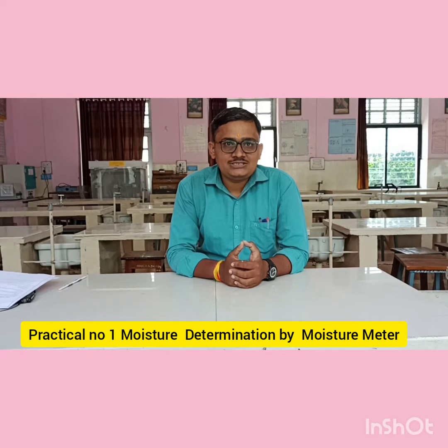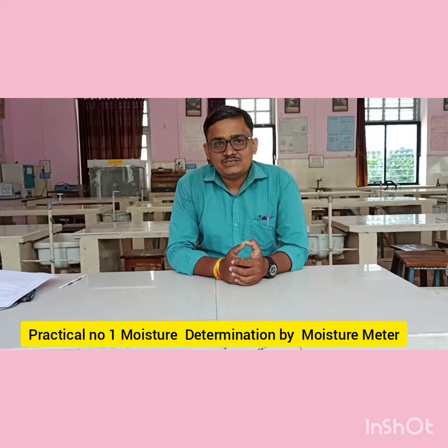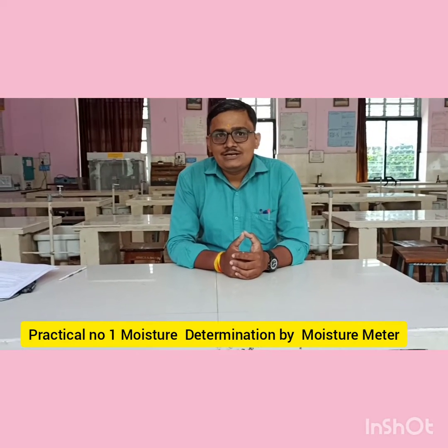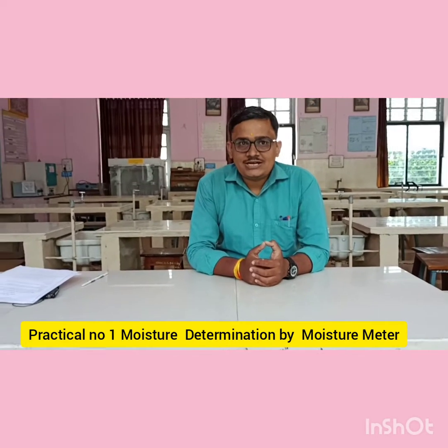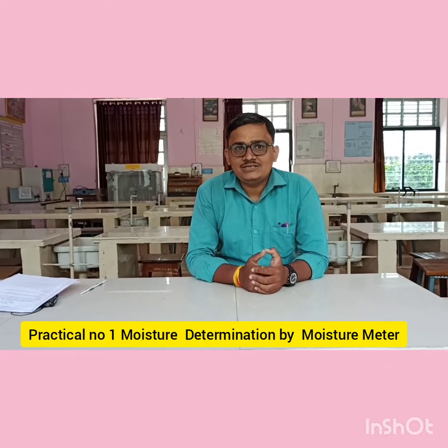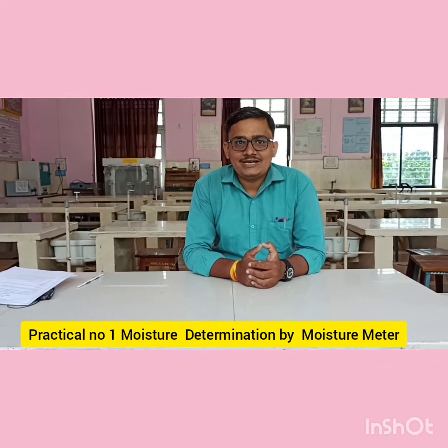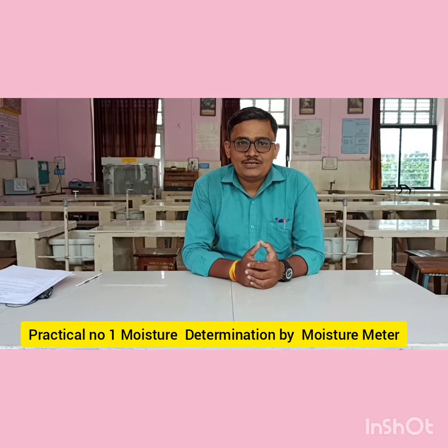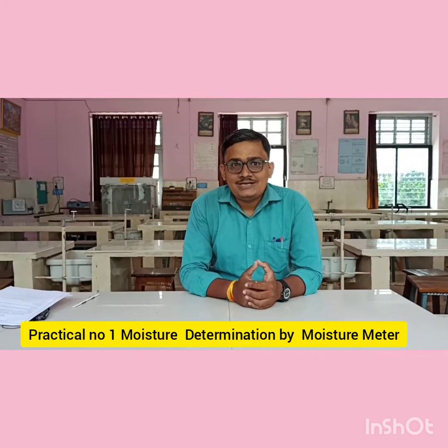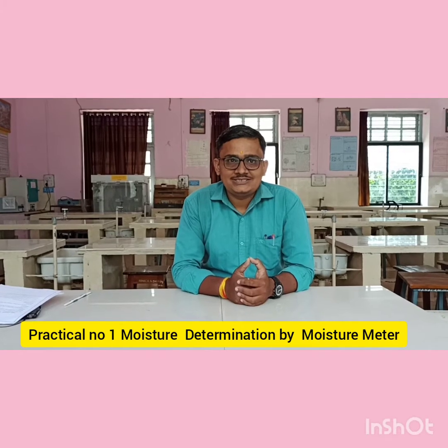First we are going to see the digital moisture method. The principle is that moisture is determined on the basis of the electrical conductivity of a seed. The second method is the oven method, where moisture is determined by removing the moisture from the seed.